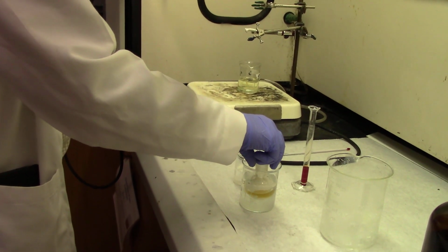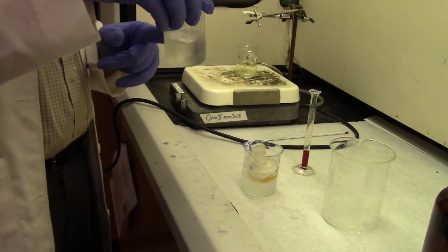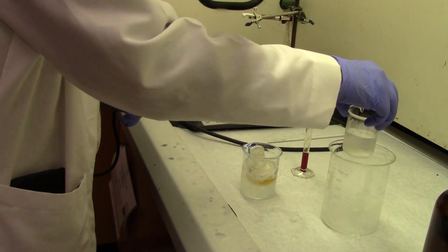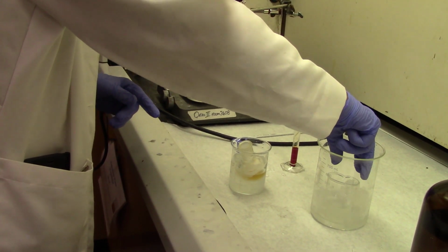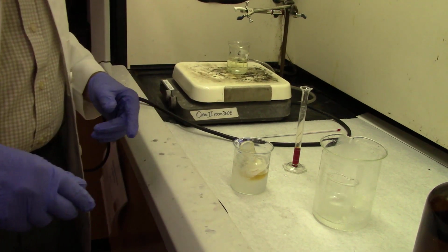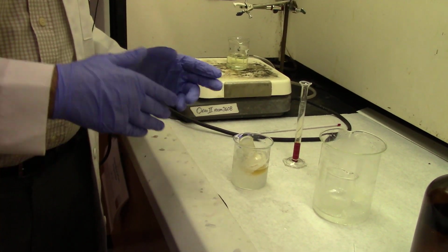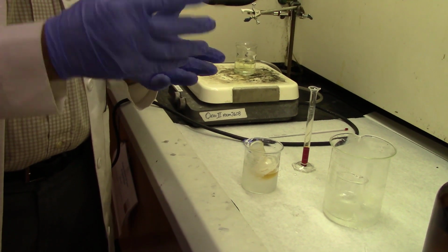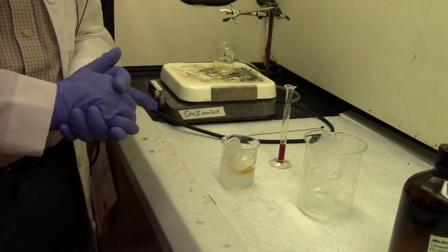And now we're going to cool it. It was not very hot to begin with because remember, we were just heating it at 50 degrees. So we cool it in an ice water mixture, and we also pre-cool some DCM, dichloromethane, that we have to use later for washings. So the big beaker has a small beaker.